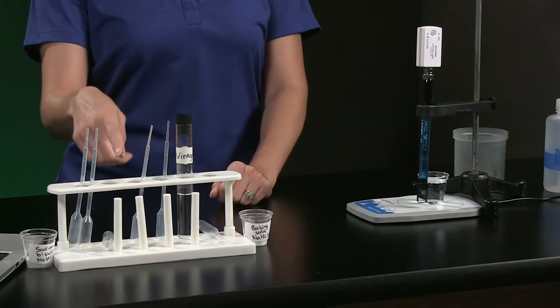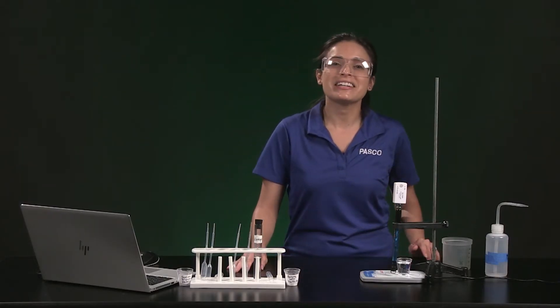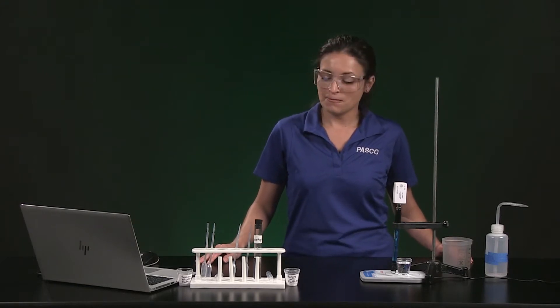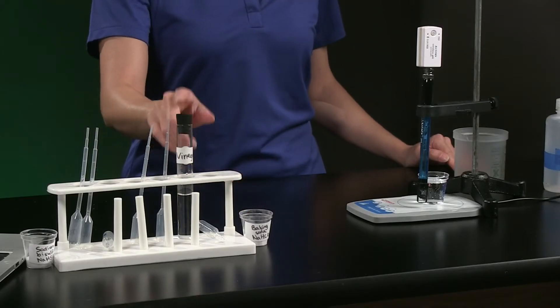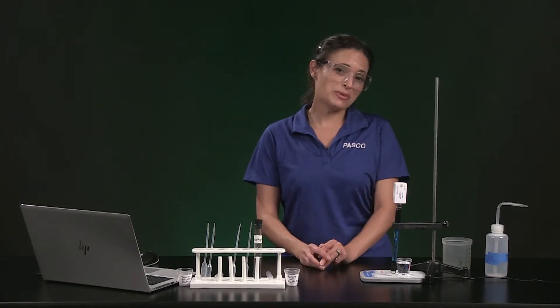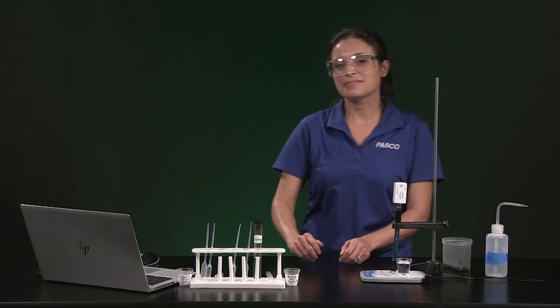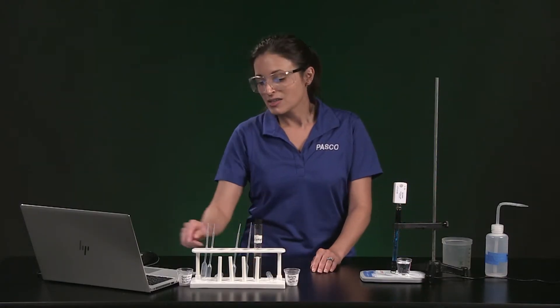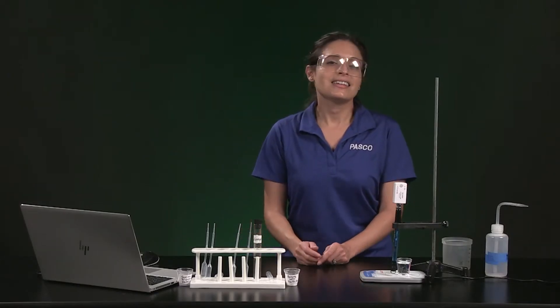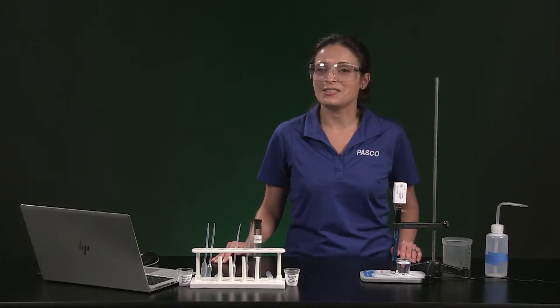I have labeled six pipettes to help keep track of which substances to combine in order to make and collect carbon dioxide gas and sulfur dioxide gas. First, I will combine baking soda and vinegar to make carbon dioxide gas. Then I am going to collect the carbon dioxide gas and watch what happens to the pH of water as I bubble the gas into the water. Next, I will combine sodium bisulfite and vinegar to make sulfur dioxide gas and see what happens to water pH when I bubble SO₂ gas into the water.